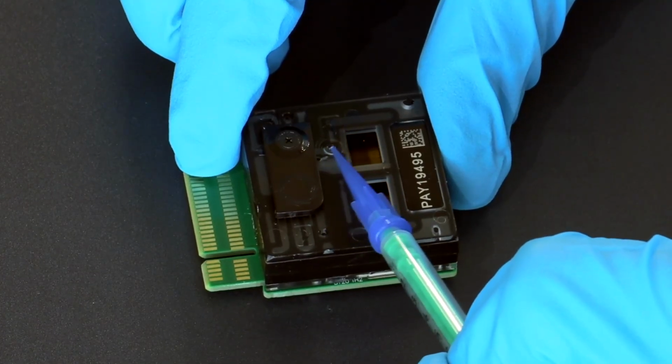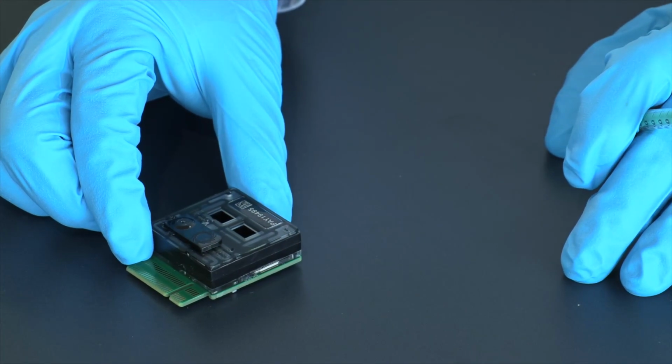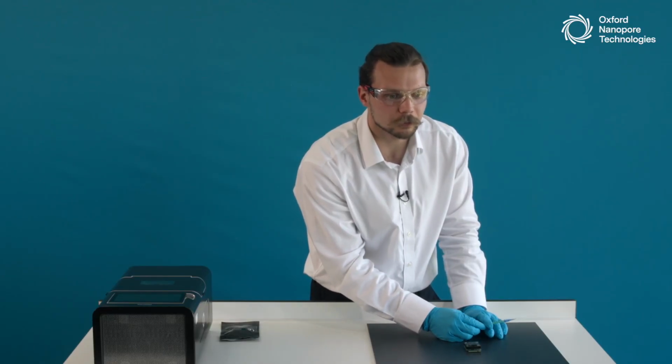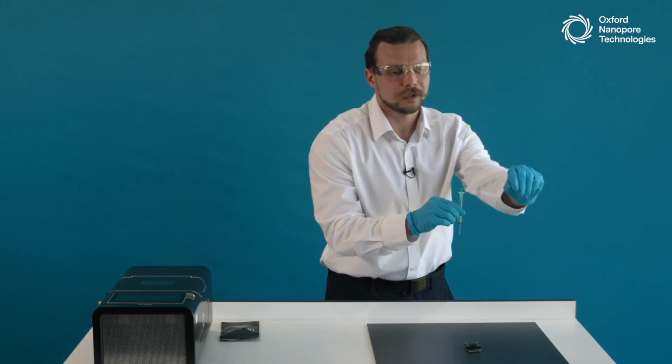This gray colored channel suggests that we have a little bit of air inside of the priming port. Now, we don't want any air inside of the flow cells because they can damage the arrays, as well as air and air bubbles do not pass current very well, so they can just block the channels from passing the electrical current. So as the very first step, we need to remove that air.